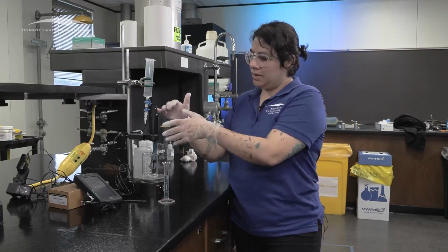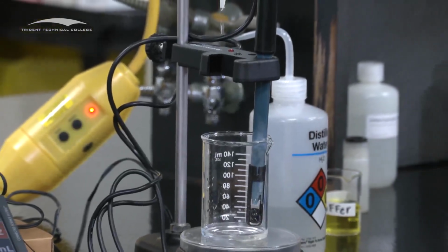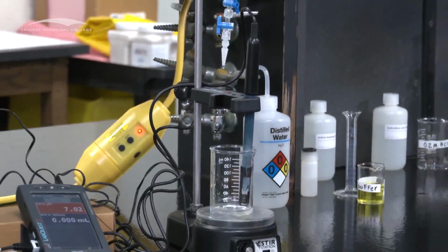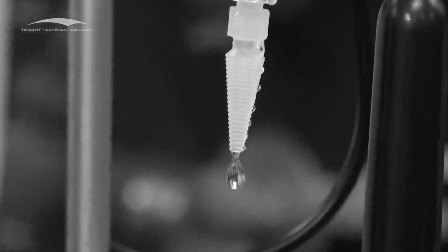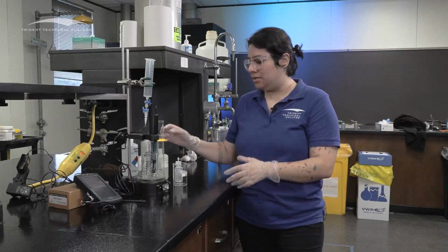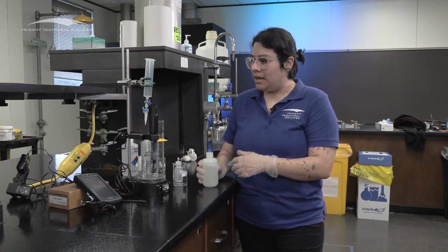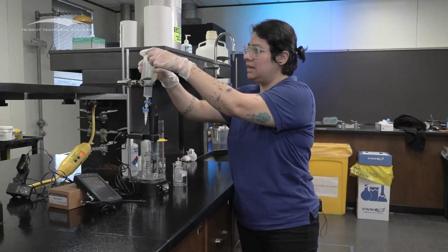When you are ready, again, we don't want to move this. So to empty it, just open it, make sure that the beaker is underneath it. Don't move anything else. So now we are ready to titrate. We're going to start with the easier one, which is a strong acid, strong base. I'm going to show you the easier one, and then you should be able to do the more difficult one, which is the weak base, strong acid. So while this is still open with the beaker underneath, I'm going to run some sodium hydroxide to make sure that it's clean.